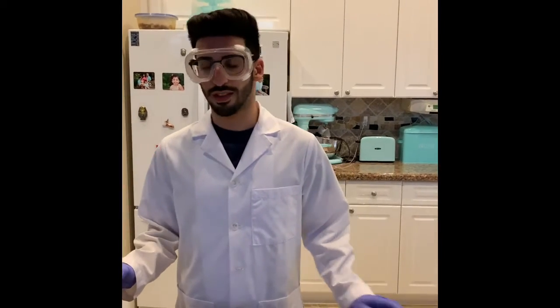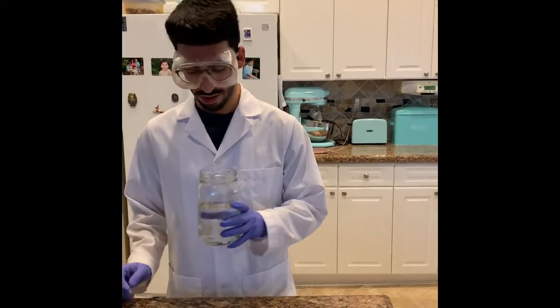pH is a scale which is used to specify how acidic or basic a solution is. Acidic solutions have a lower pH, therefore are lower on the scale, and basic solutions have a higher pH and are therefore higher on the scale. I have some household items that have several pHs.